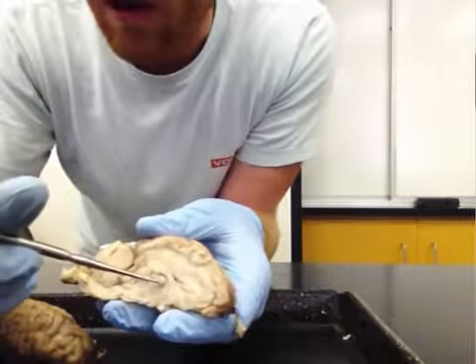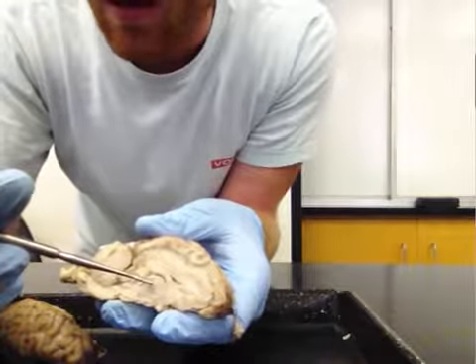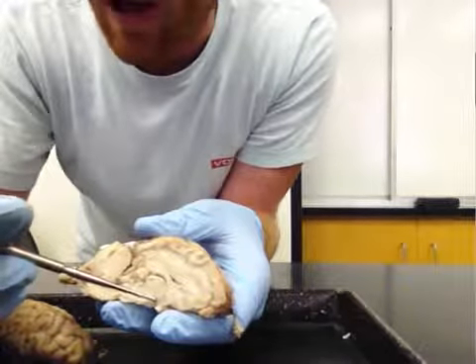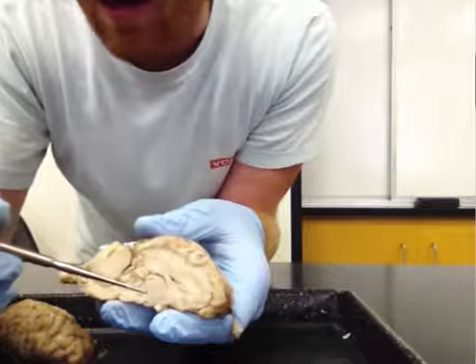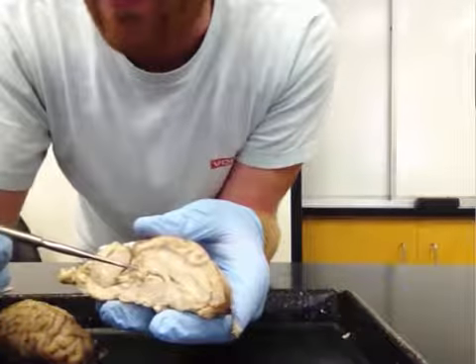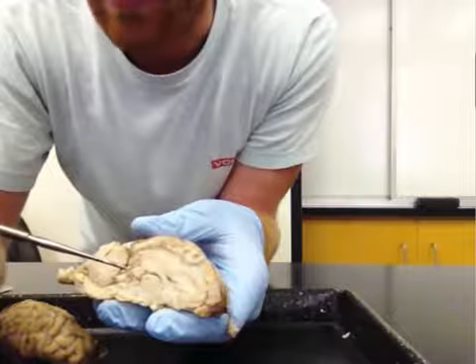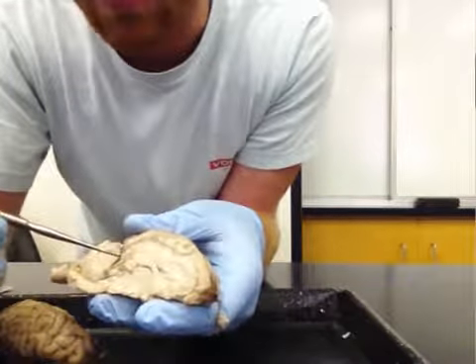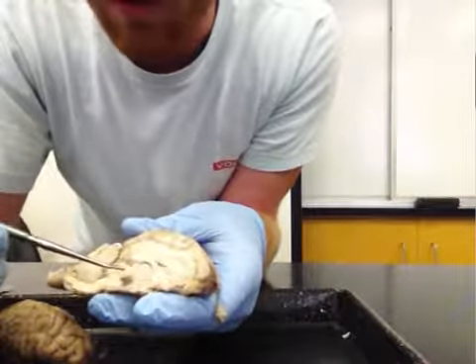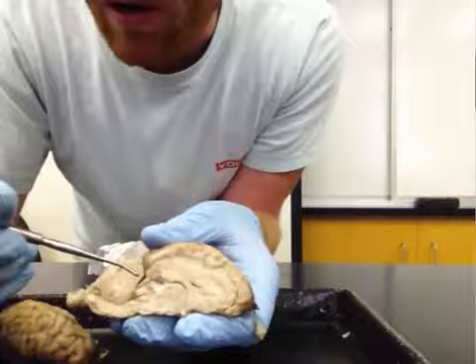And right in the middle, right here, is this large sphere, right? This is the thalamus, right here. Just below or ventral to the thalamus, we have the hypothalamus. And then posterior to the thalamus is the pineal body. And Descartes actually thought that this was the seat of the mind right here because there's actually only one pineal body in the brain, unlike most of the structures that we'll see. And you can see that the pineal body, you can actually just remove this all the way from the brain there, this little sphere.